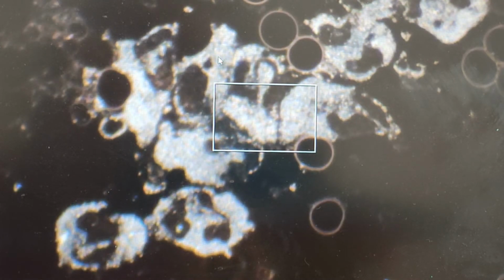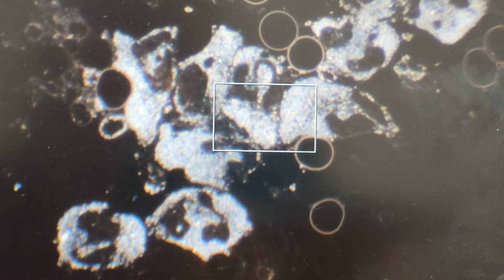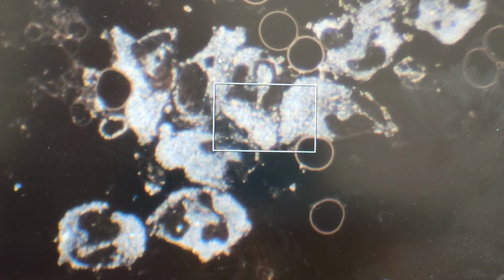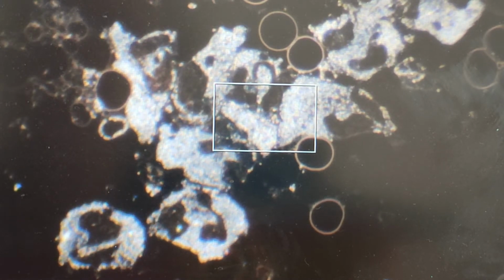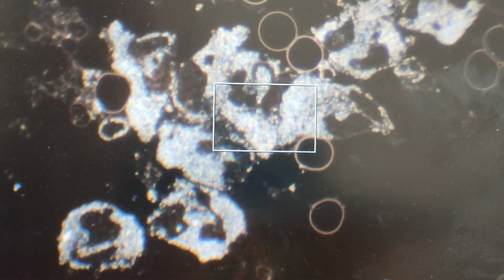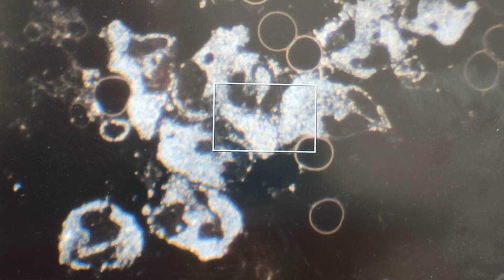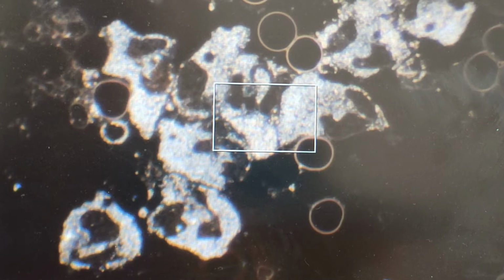This sample is an aged blood sample, but it's from a client who has particularly vibrant white blood cells. I mean, these white blood cells, these neutrophils, are very active. I'm just taking a photo. These white blood cells are very active, and let me see if I can count them up. 1, 2, 3, 4, 5, 6, 7, 8, 9, 10. We have 10 cells in one area.